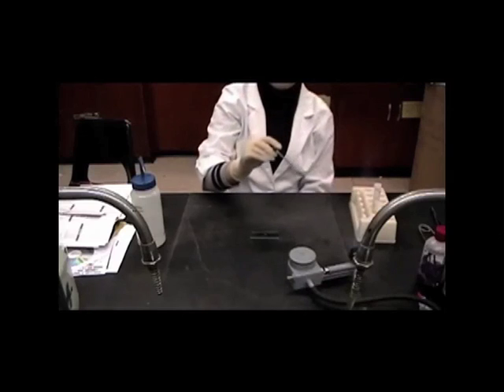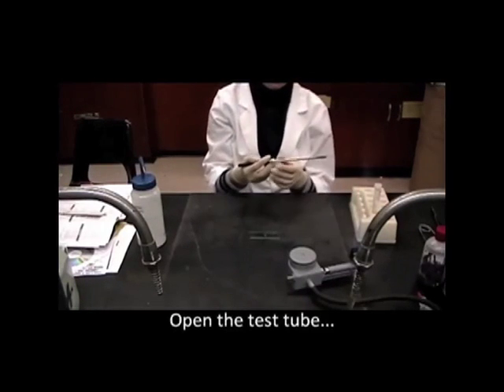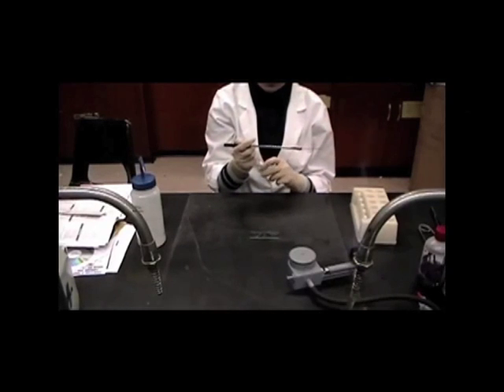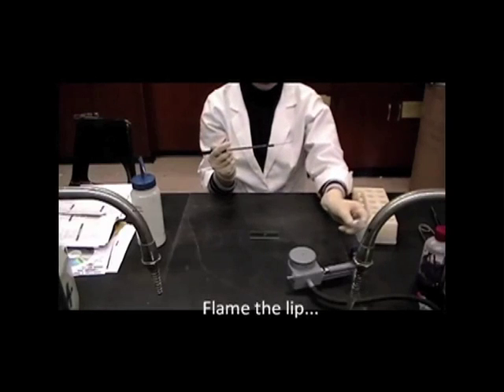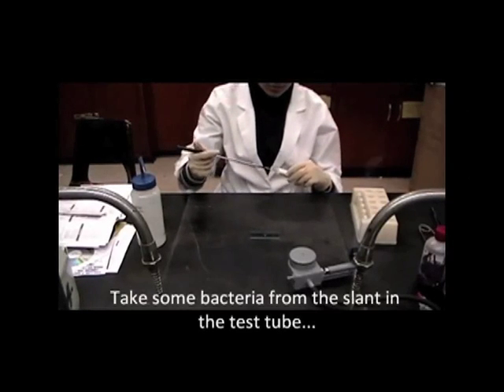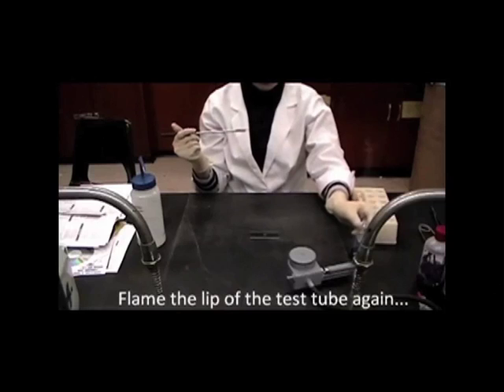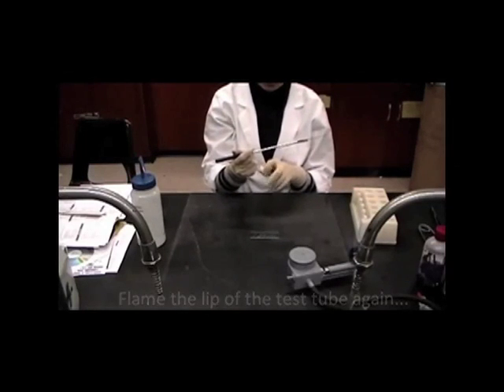The next step is opening the test tube, flaming the lip of the test tube, and taking some bacteria from the slant in the test tube. Flaming the test tube, and putting the lid back on the test tube.